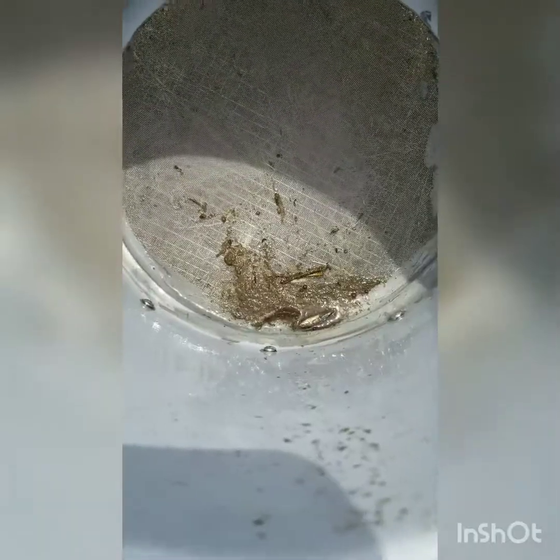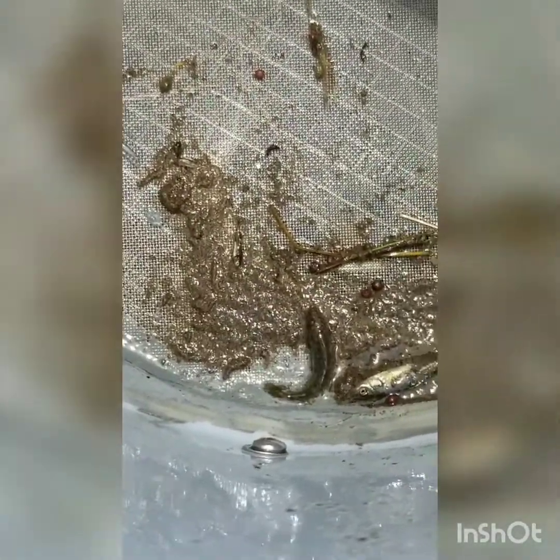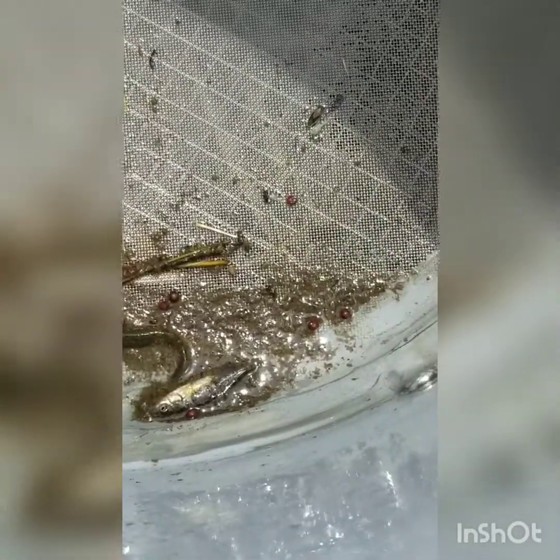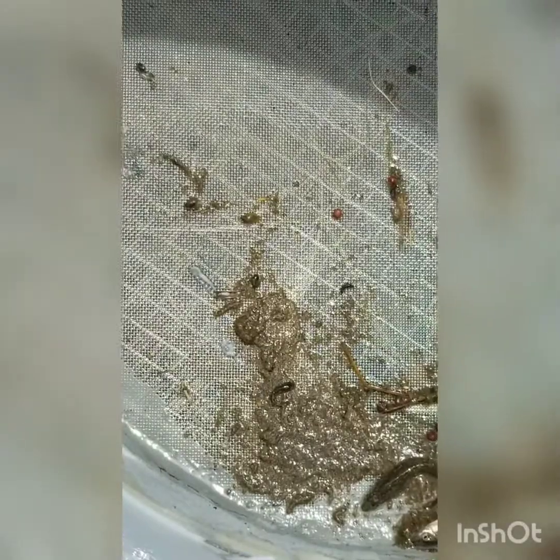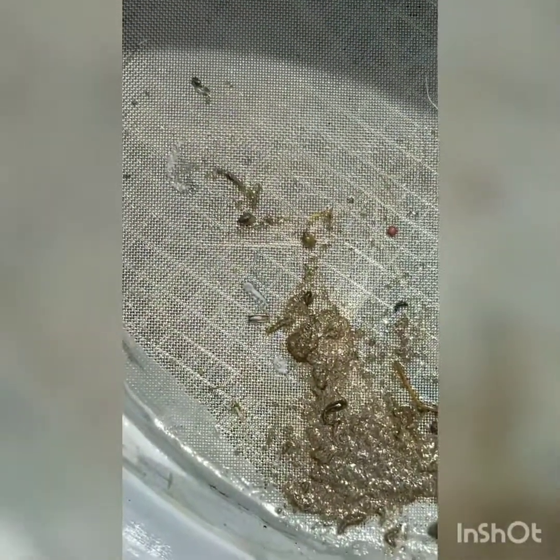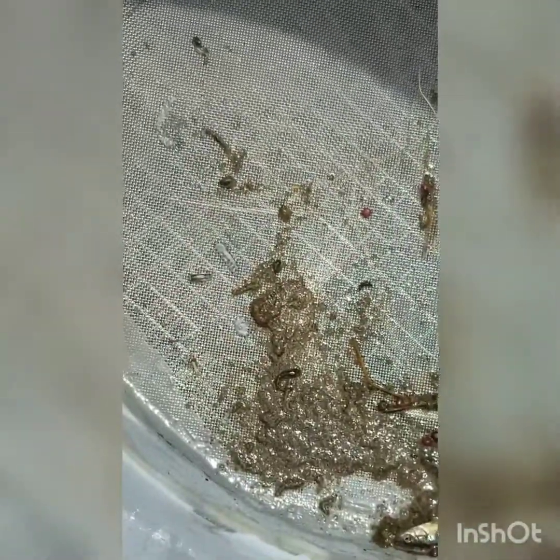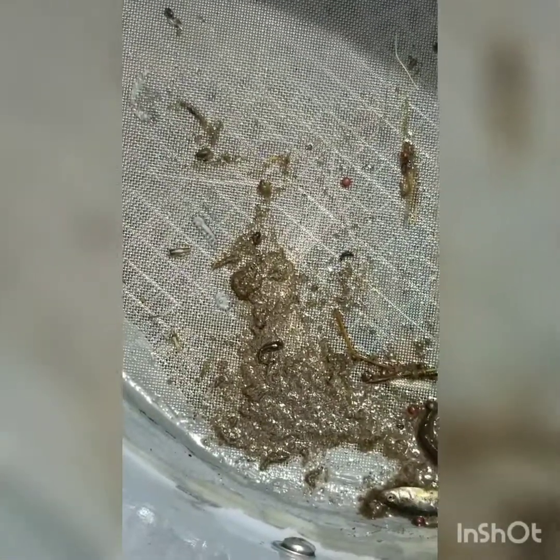Here's a little closer view of what we've got in here. You can see a couple little fish. Some of those red dots, I believe, are water mites. This guy moving around up here, right? Let's see. Ooh, there is a water boatman, Corixidae. Yeah, he just moved. We often get quite a few leeches, but again, in these riparian areas, typically not a huge amount of diversity.